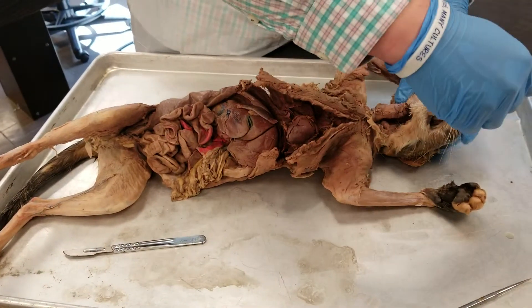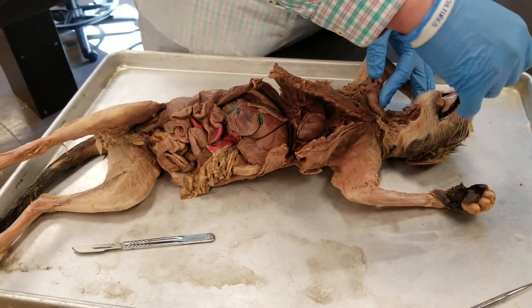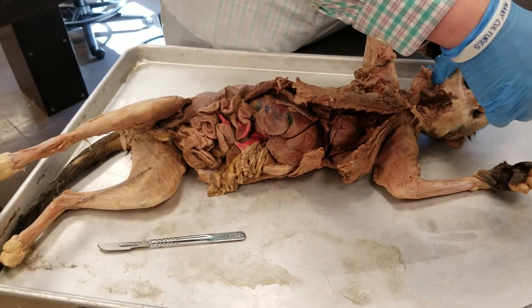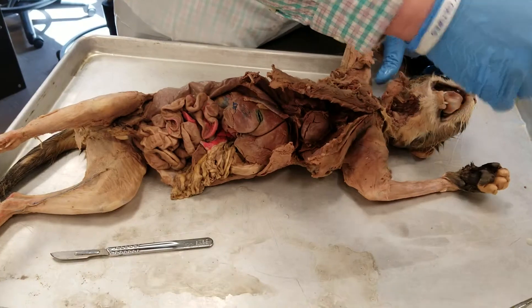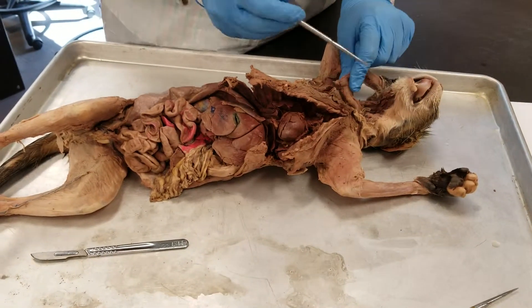Right here we're going to connect the probe into the larynx, into the larynx right here. As you can see, it connects down into this tube right here.